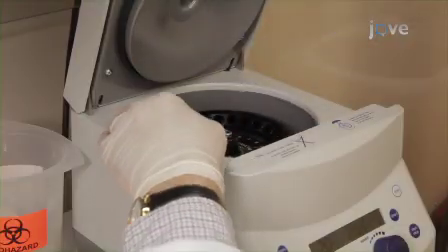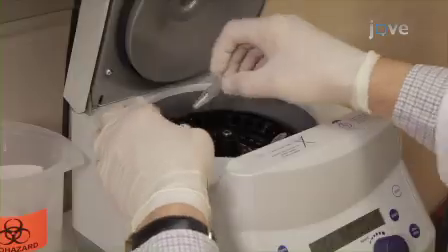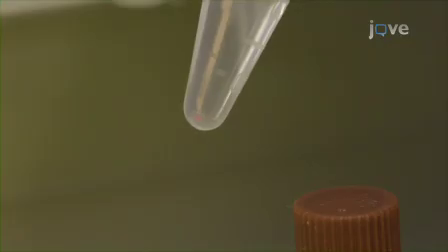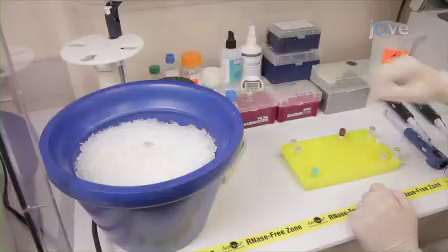When centrifugation is complete, gently remove the tube from the centrifuge, being careful not to disturb the cDNA pellet. The pellet should be pink because of the pellet paint and approximately the size of a grain of salt and on the side of the tube under the hinge. Place the cDNA pellet on ice and proceed immediately to cleaning the pellet.